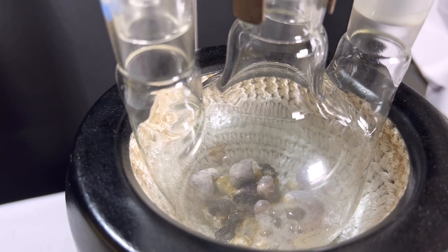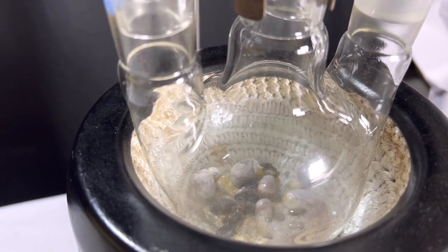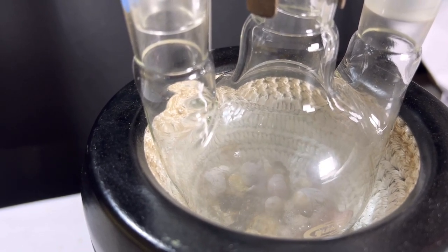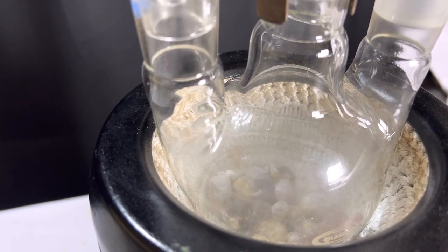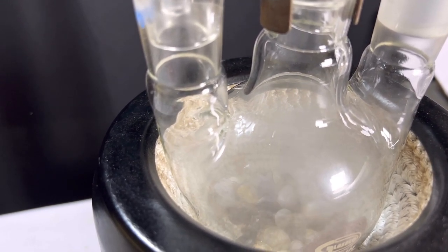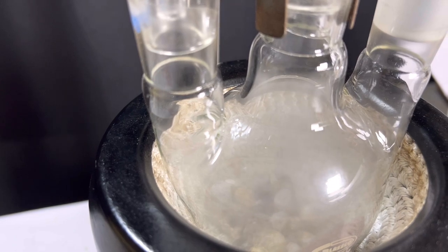When we see the inside of the flask we see sodium metal in molten state due to the heat of the reaction, and this molten sodium is reacting with the molecules bromobenzene and bromobutane to form the thick white fumes. You can also see the reflux has started.